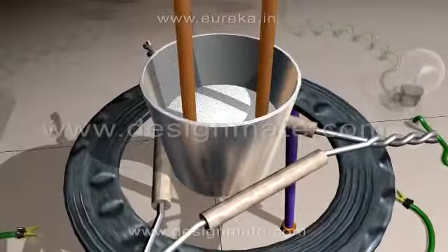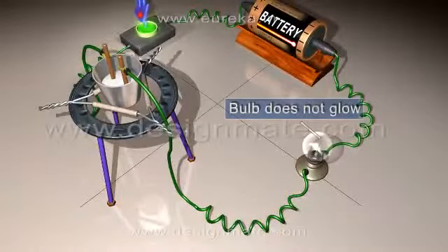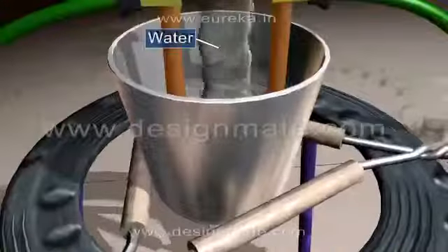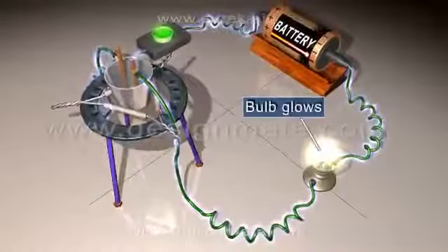Now repeat the activity using solid sodium chloride. The bulb in the circuit does not glow. Pour some water in a crucible. Notice that the bulb glows.